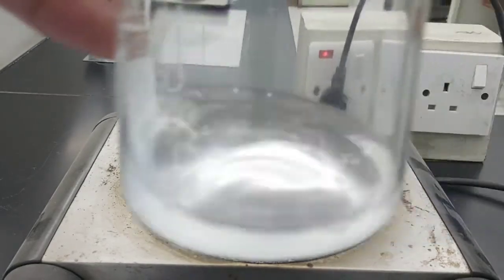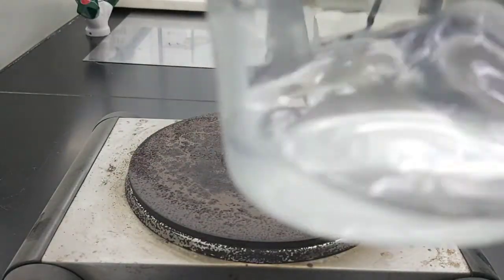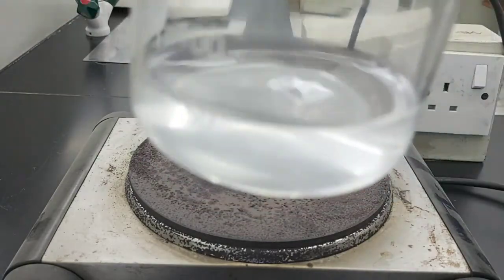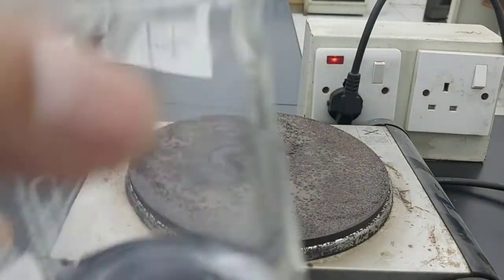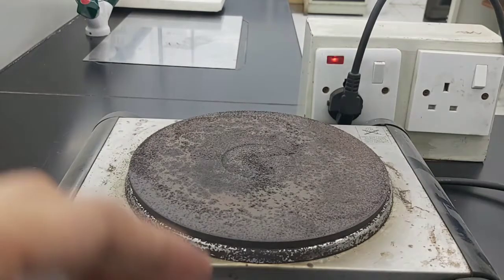Okay, and then observe. So what happens to the salt? Will you be able to see the salt? So if your answer is no, why do you think, what happened to the salt? And then hypothesize how you might return the salt to its original state by using the materials you have. So for example, we have the materials here. So in order for us to separate it, we're going to use the process evaporation.